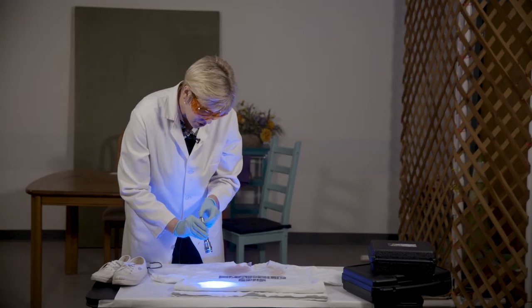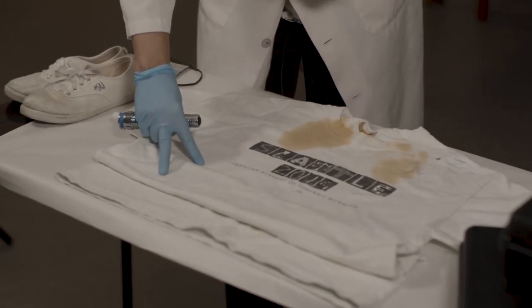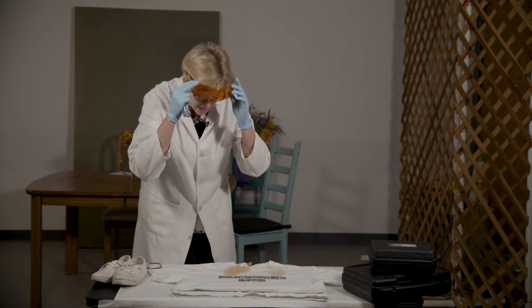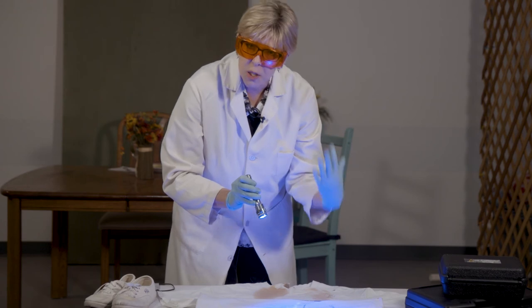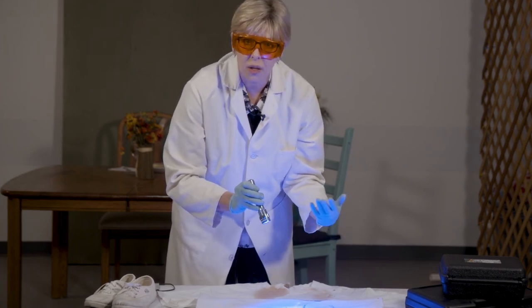Look at this — we have this long stain here that is fluorescing. But turning the light off and looking at it visually, we're not really seeing that bright of a stain. We can see closer that something is there, but it's not as evident as it is underneath the alternate light source. Flipping the shirt over, we see some additional stains that could be of importance, but we're also seeing visual stains — such as this orangey stain — which is fluorescing as well. Just because it fluoresces doesn't mean that it's biological in origin, nor does it necessarily mean it's of importance to a forensic case.